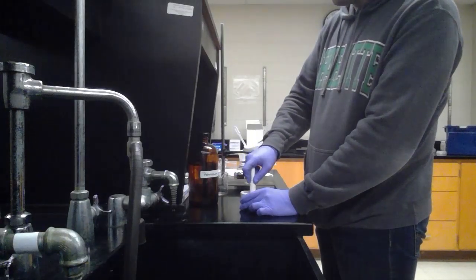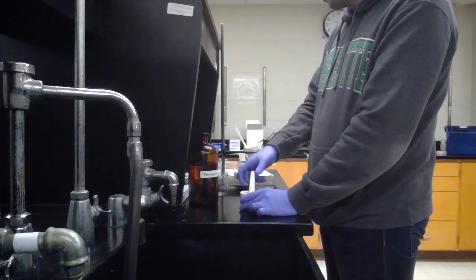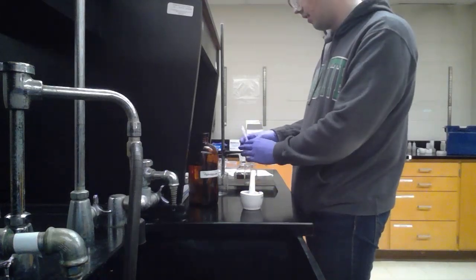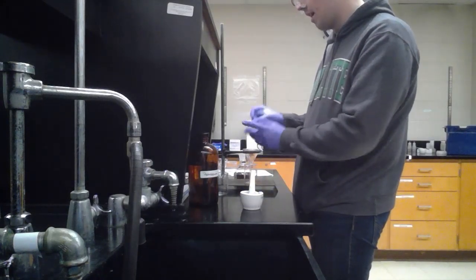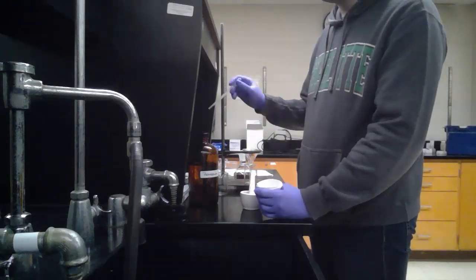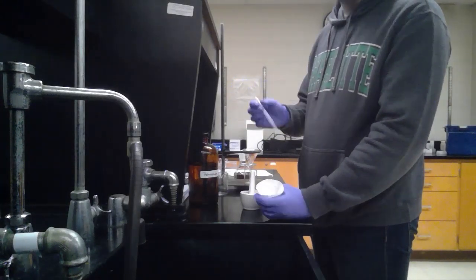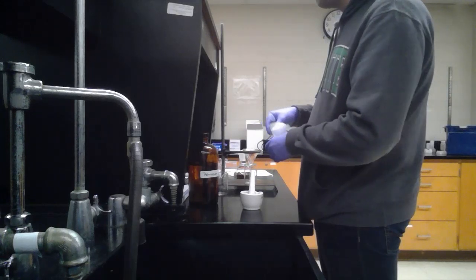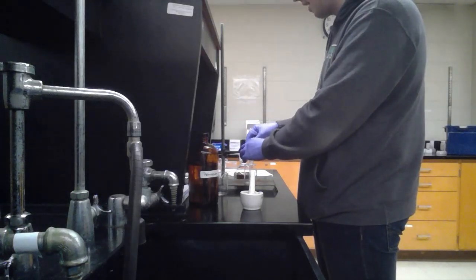You kind of do this for about a minute or so, and then what you'll do is you're going to take a pipette, which I have set up over here. We have a filter paper that we've weighed out, and that filter paper, it says coffee filter in your handbook, but this is 0.09 grams. I've already weighed that out and put that here.